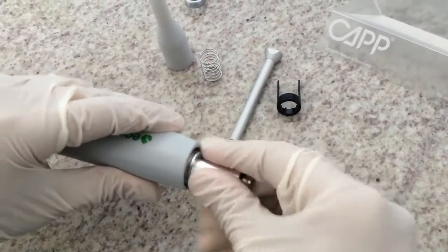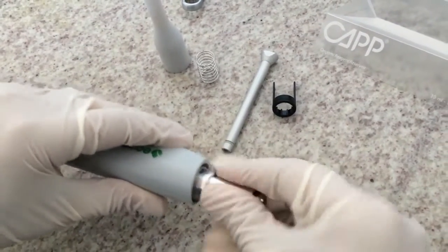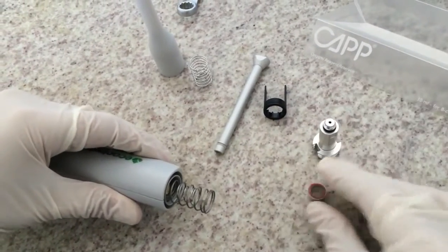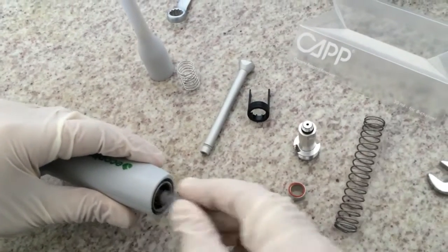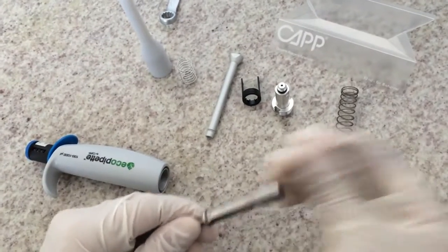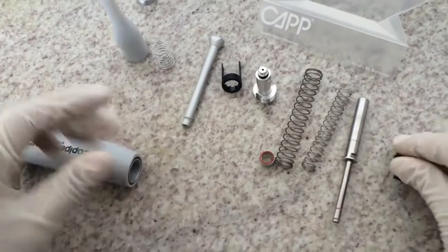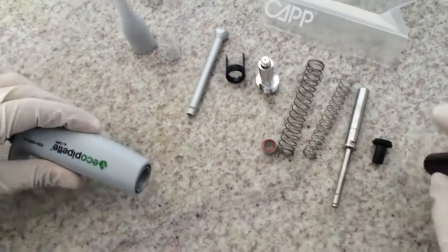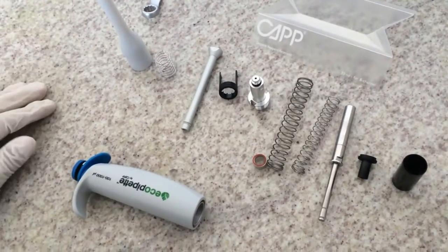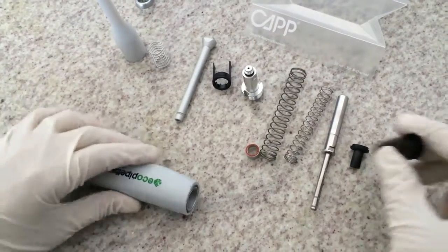We will then access the seal, O-ring and piston of the pipette. These can be replaced or cleaned and lubricated depending on their conditions. Now we're going to assemble everything back.